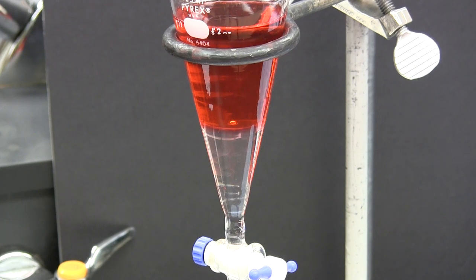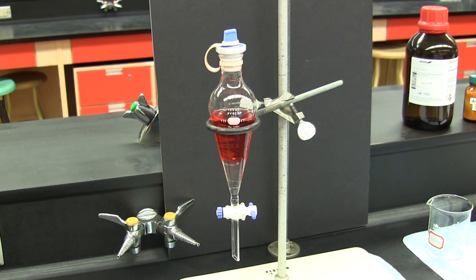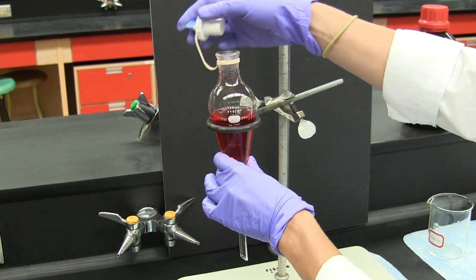However, it's better not to assume which layer is which and you may be given instructions on how to determine which layer is which. The stopper is removed from the sep funnel.